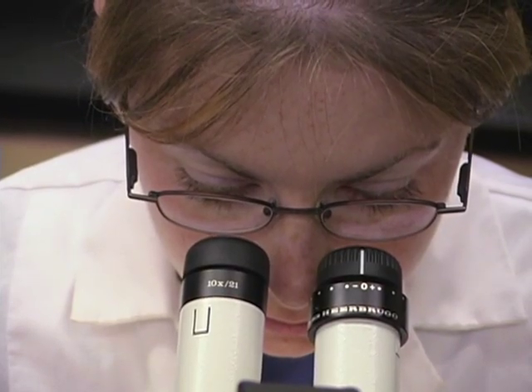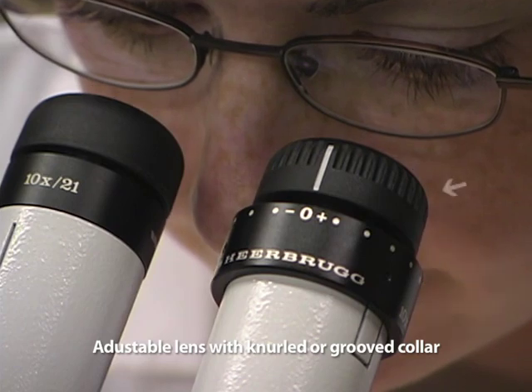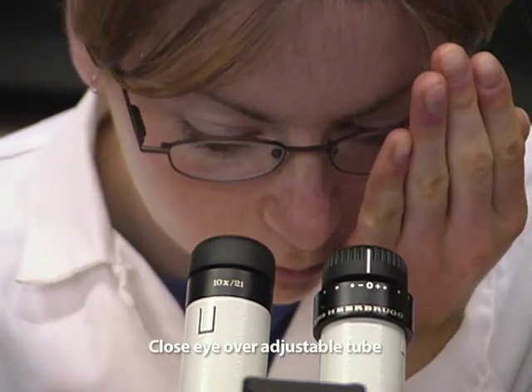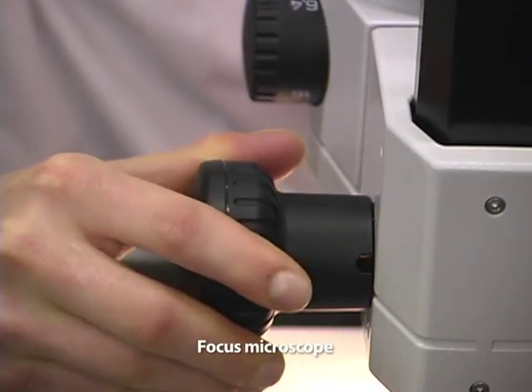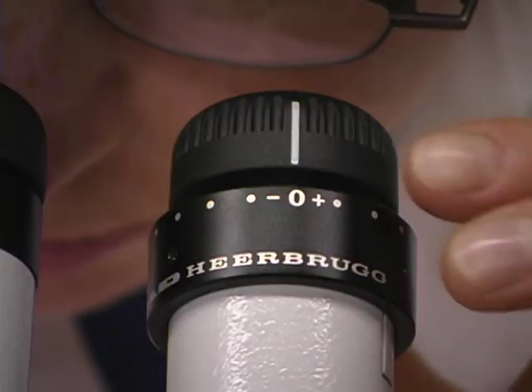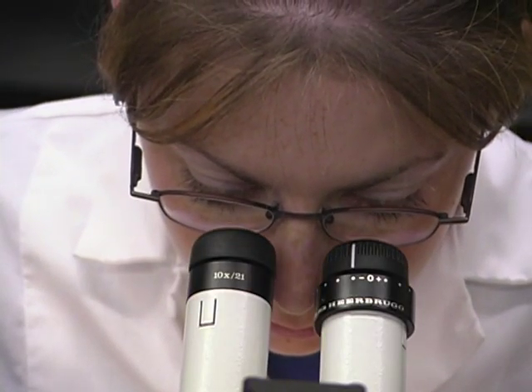To make the diopter adjustment, first determine which one of the two ocular lenses is adjustable — usually this is easily detected by the presence of a grooved or knurled collar. Close or cover your eye on the side of the adjustable tube, and using your open eye and the focusing knob, bring the image into focus. Then close or cover the eye on the non-adjustable side and open your other eye. Use the knurled knob on the adjustable ocular tube to focus the image. Open both eyes to see the object in complete focus.